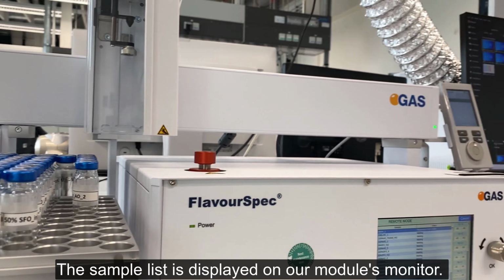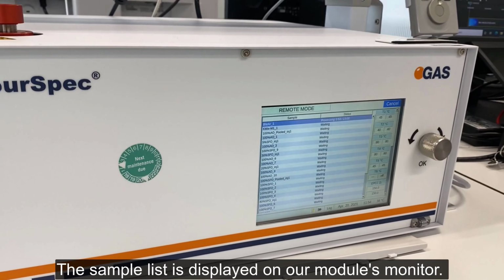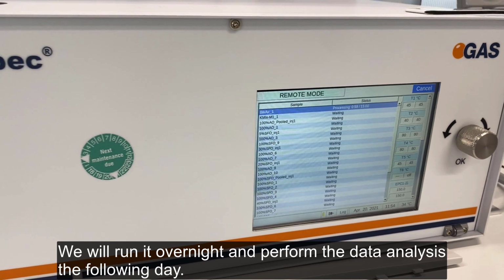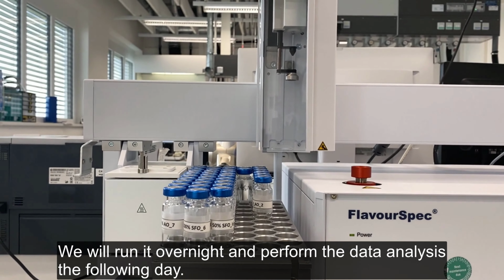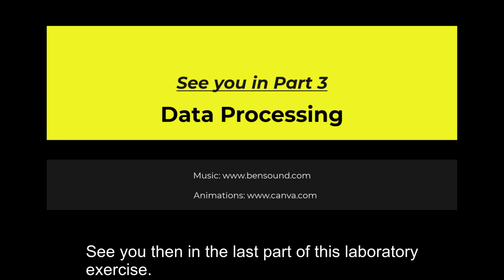The sample list is displayed on our module's monitor. We will run it overnight and perform the data analysis the following day. See you then in the last part of this laboratory exercise.